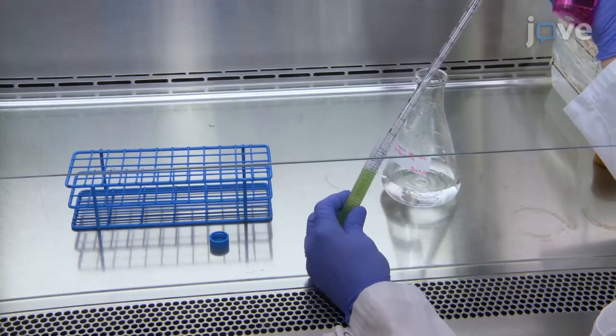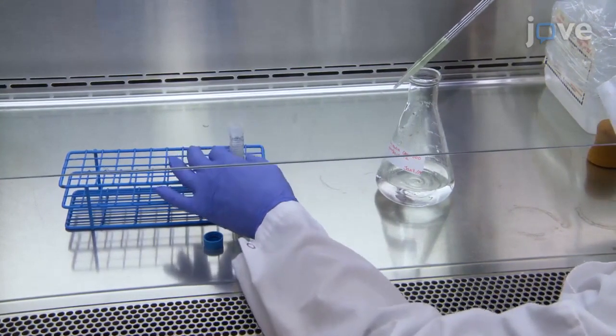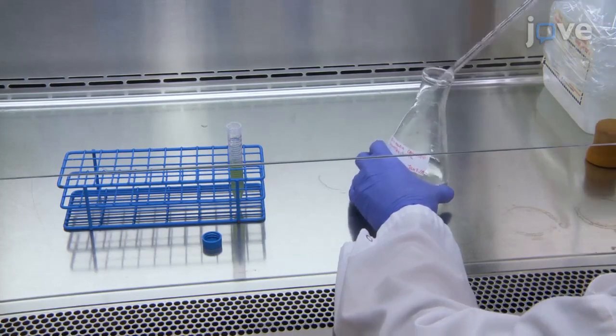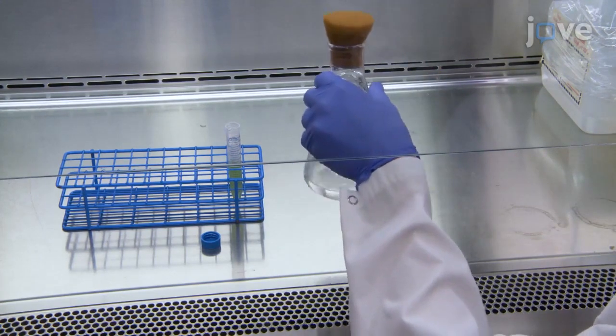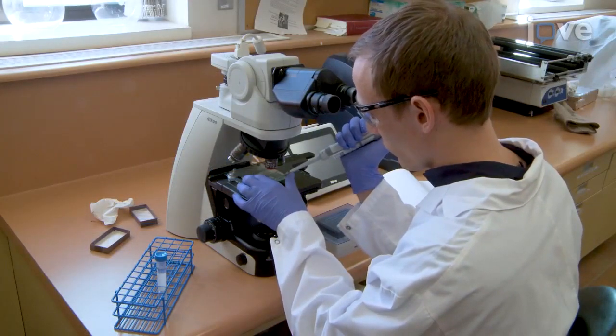To prepare a sample for microcystin analysis, inoculate 30 milliliters of sterile cyanobacteria growth medium to approximately 5 × 10^5 cells per milliliter under aseptic conditions in 250 milliliter Erlenmeyer flasks, monitoring the cell density with a hemocytometer.